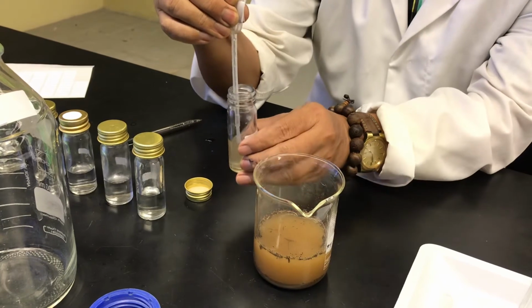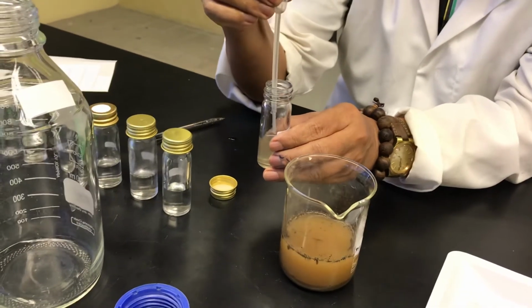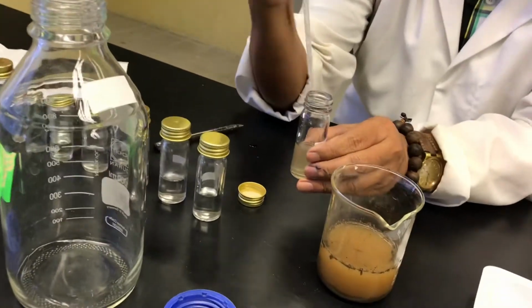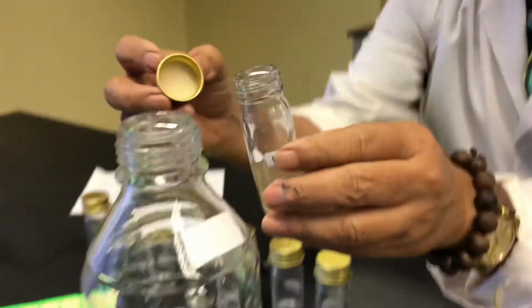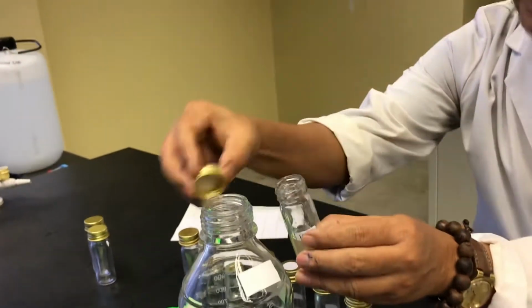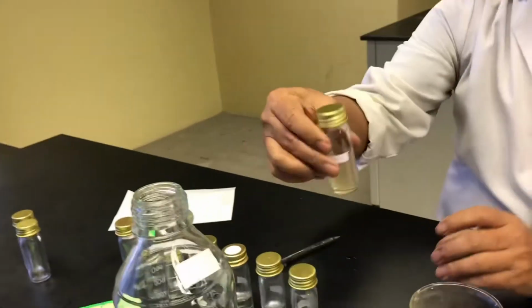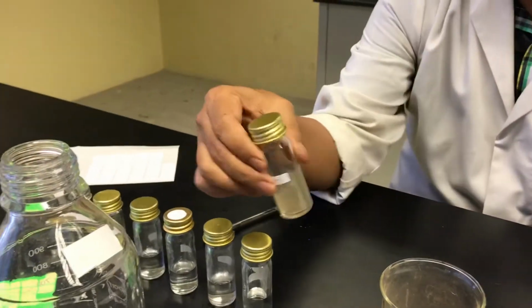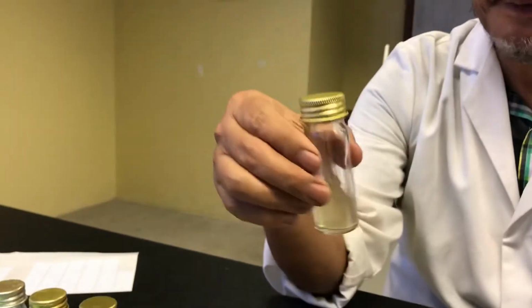Okay. Then you rinse it. Don't touch the edge. Okay, so you got that. Then you go to the flame. For example, this is a flame. Then you close it, and then you swirl this way. If you have a vortex, it's okay, but it's okay not to vortex. Sometimes you just swirl like that.